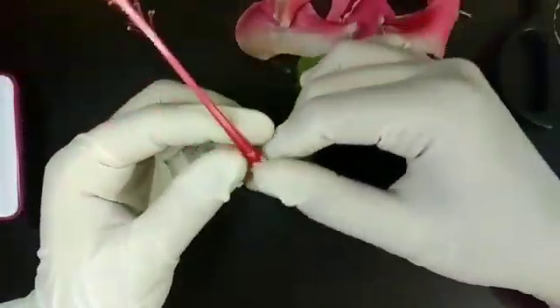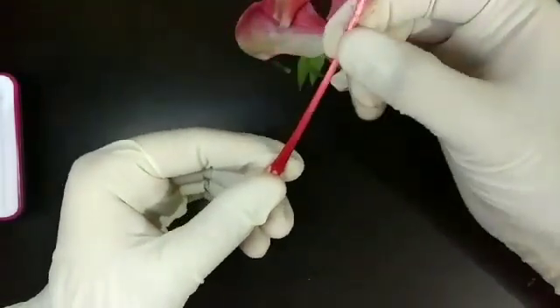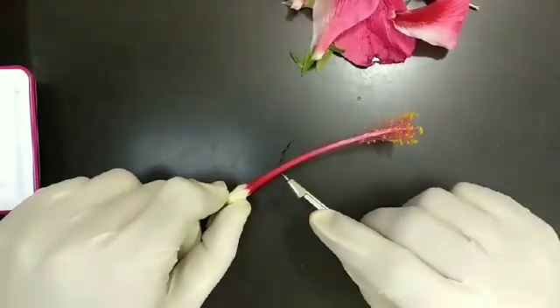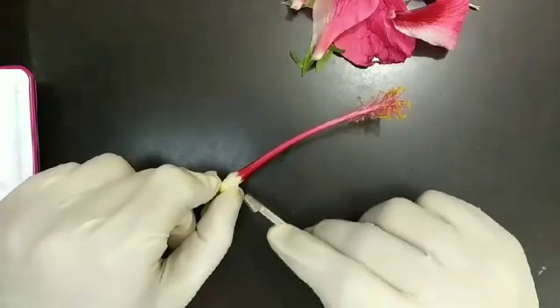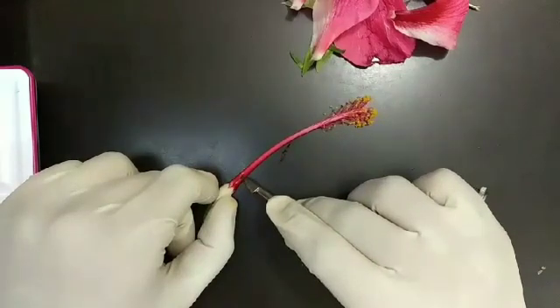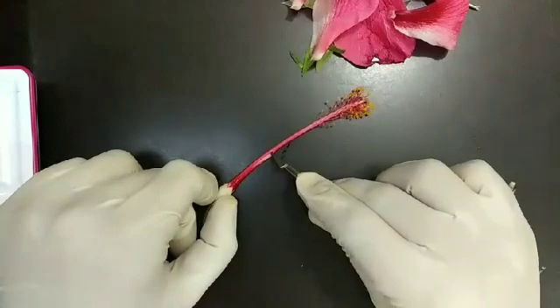Now we are going to use a needle to dissect this area. Now we are going to dissect the style of the flower to get the ovary. Be very careful while doing this.